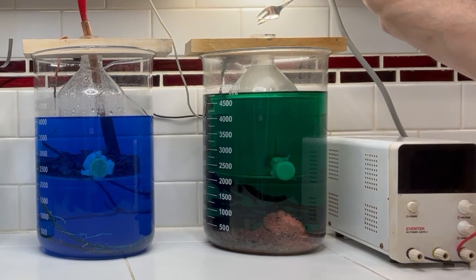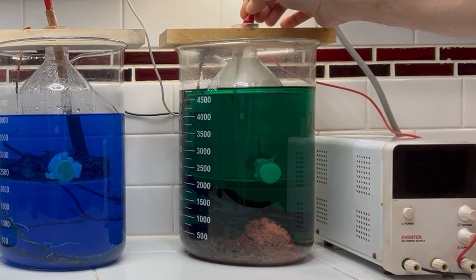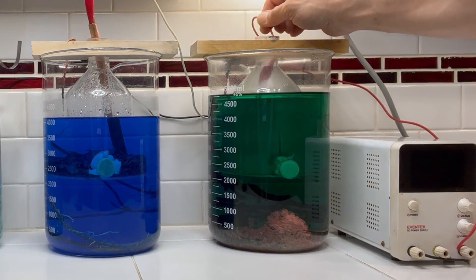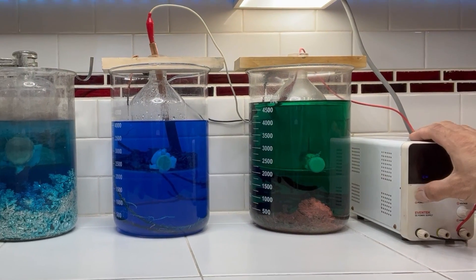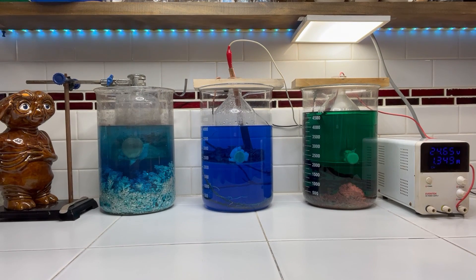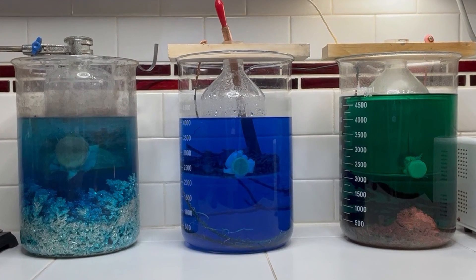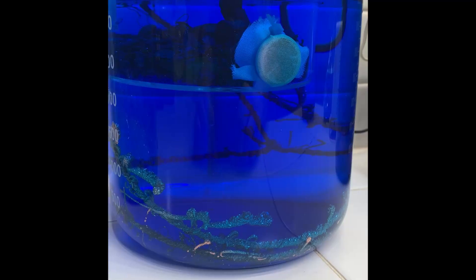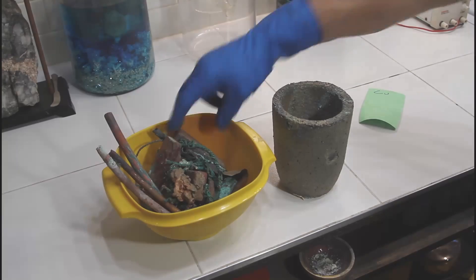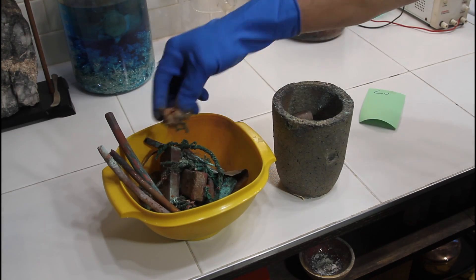These cells are the workhorse of the operation. Silver plated forks and spoons go right down into the anode bottle in my number two copper cell that's full of copper sulfate solution. These pieces I'm refining are a high concentration of copper, and some are double and triple plated, so I'm hoping for roughly a 3% yield of silver. In my number one copper cell I refine pieces that are more like 95% copper but still may have some impurities like base metals or any uncaptured silver from the number two copper cell. I also put all of my leftover copper anode pieces into the number one cell.